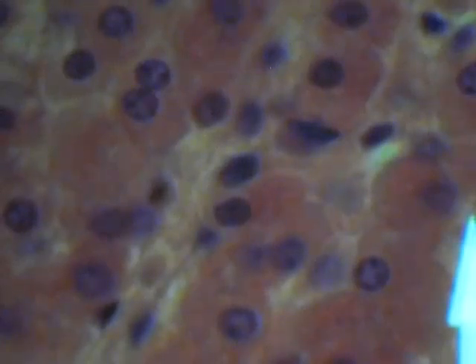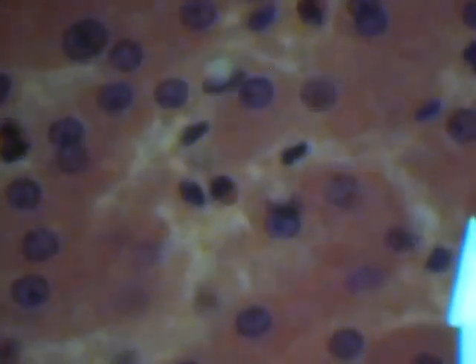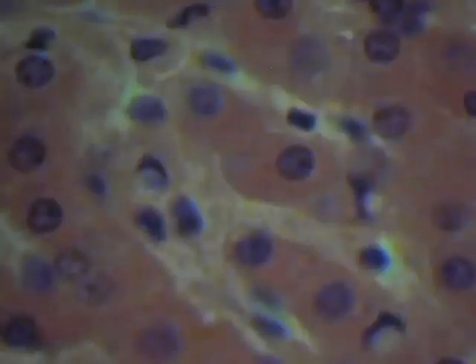Do you see any macrophages? Yeah, so the macrophages, remember what are they called? Kupffer cells, right? So your macrophages, you're looking for Kupffer cells. We're pretty much looking for macrophages that have eaten. They're easier to identify. So if you see that dirty stuff in the cytoplasm, then you know those are the macrophages. And they're usually lining the sinusoids here. So you'll see them in these spaces between the hepatocytes. I'm not really seeing any in this one.